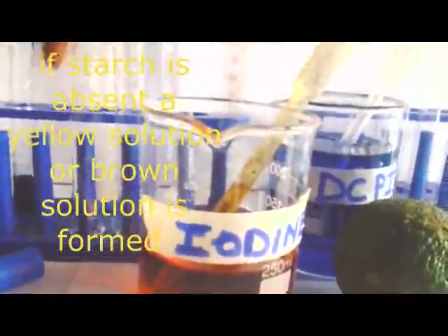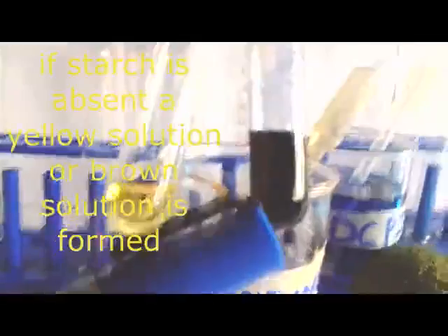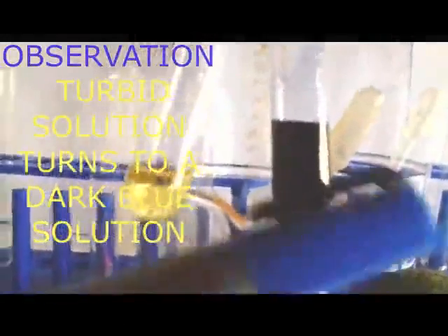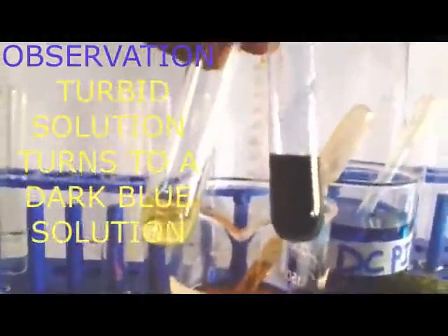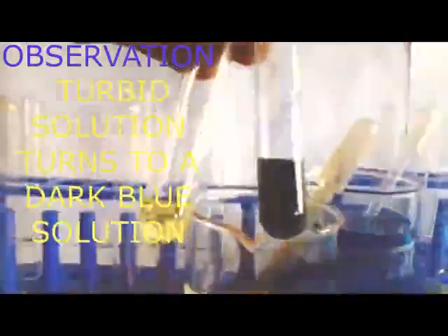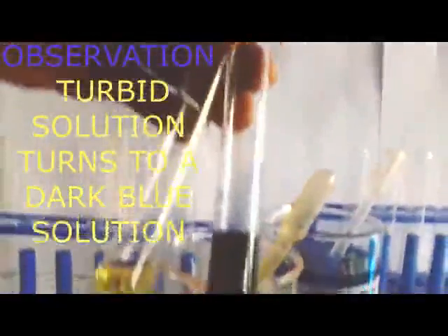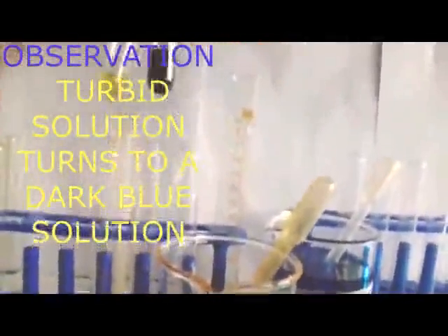But this first one, which had starch, we can say that the turbid solution turns to a black solution, a darker blue solution. You always write one color. Don't strike through, darker blue, then blue-black. That is rubbish in science. Always write what you see exactly.